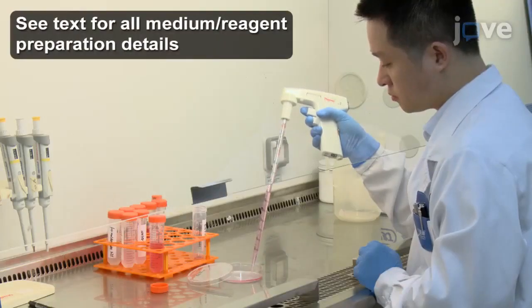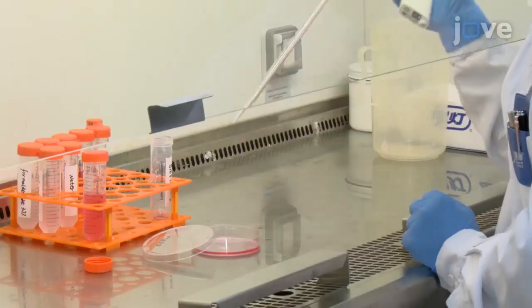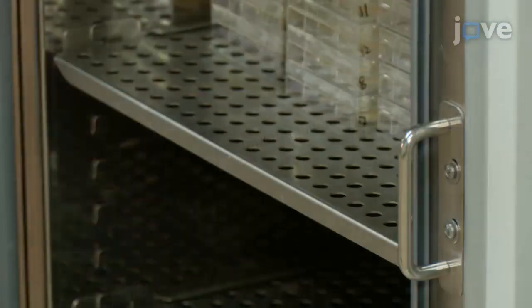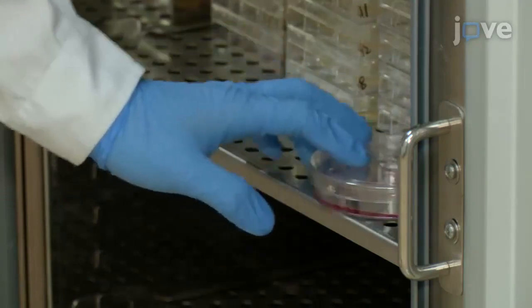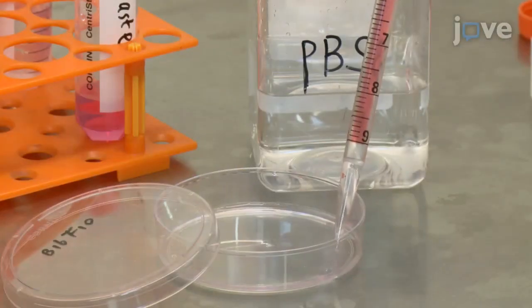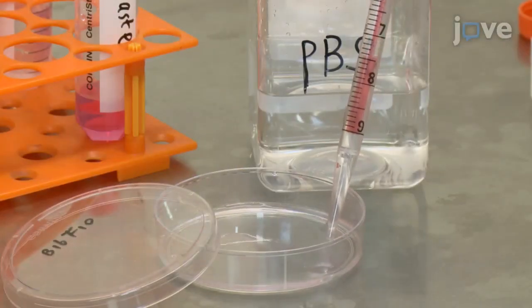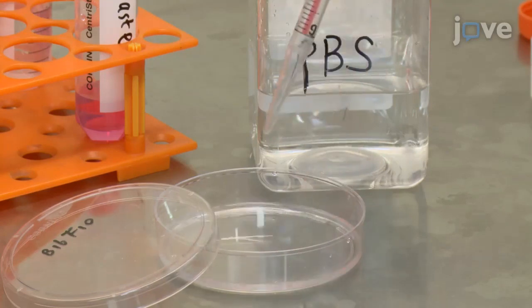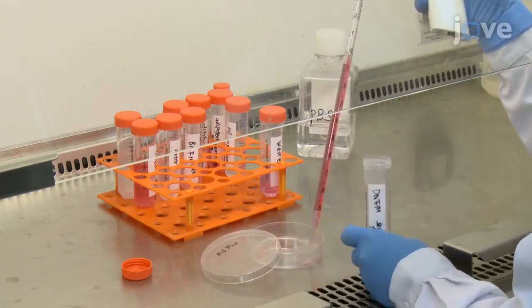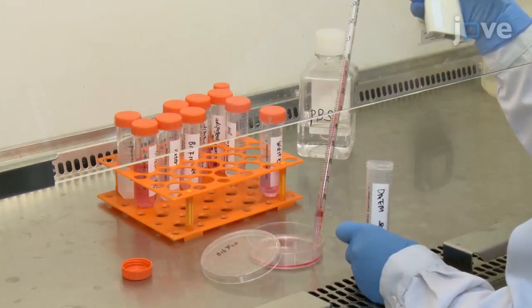Begin by seeding 2 × 10⁵ B16 F10 melanoma cells in a 100 mm dish with 10 ml of DMEM supplemented with 10% FBS for a 24-hour incubation at 37 degrees Celsius and 5% CO2. The next day, wash the about 80% confluent cell culture 2 times with 5 ml of PBS per wash, and starve the cells with 10 ml of serum-free culture medium in the cell culture incubator for 18 to 24 hours.